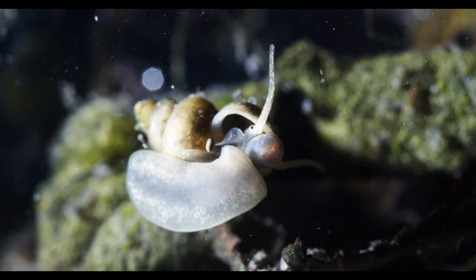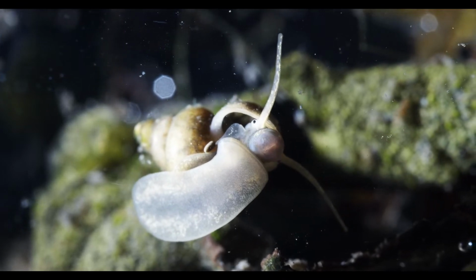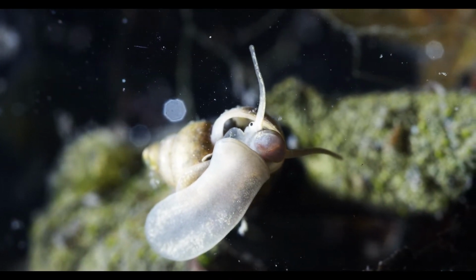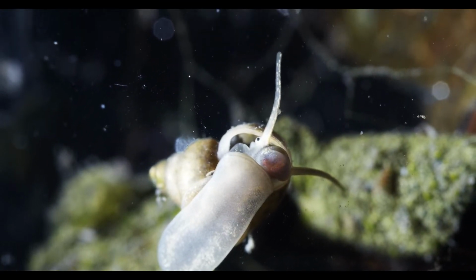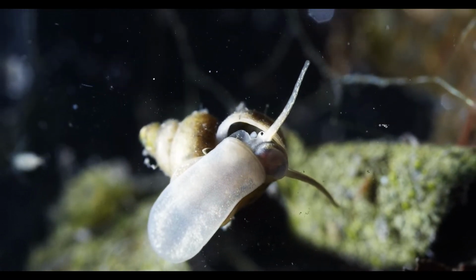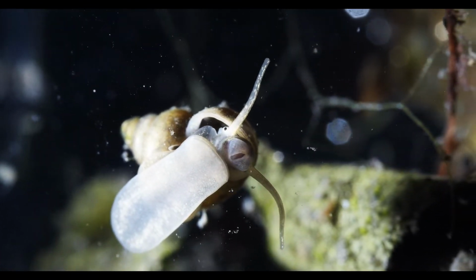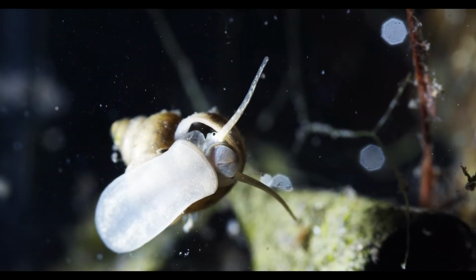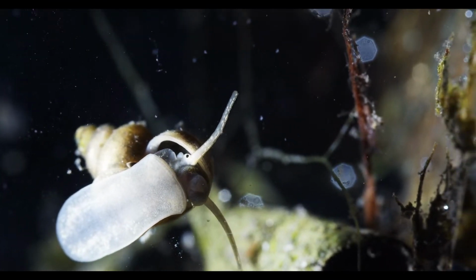But I can see it pretty well, so I have to get into OBS and see how I can make a magnified window, just double the size, like zoom in, without changing lenses, just digital zoom. But when the light is coming from the right angle, you can see the cilia on the sole flimmering.